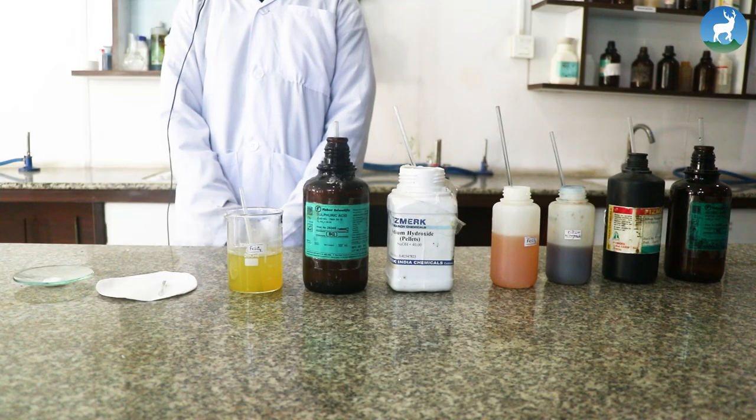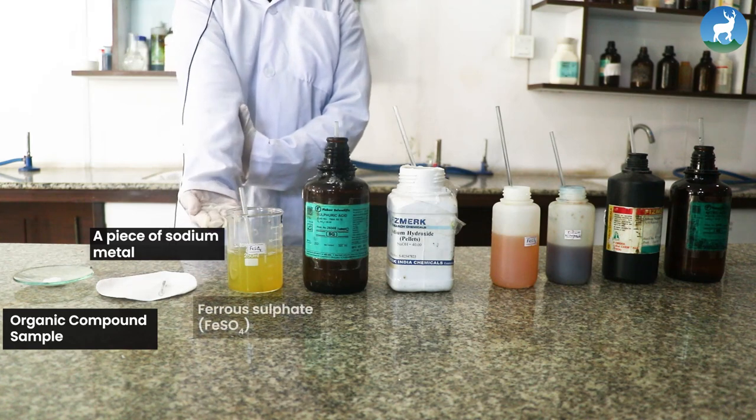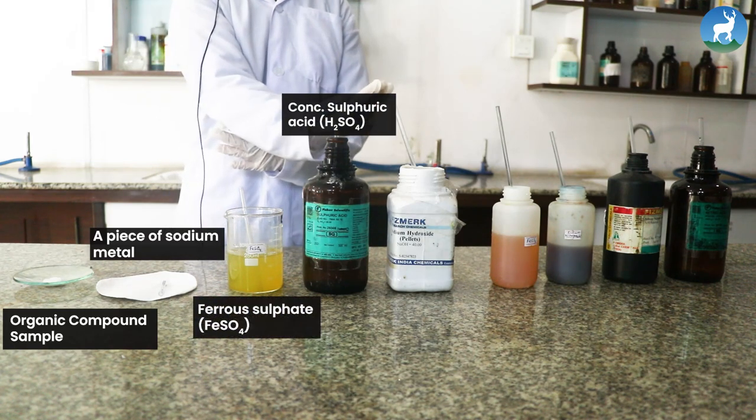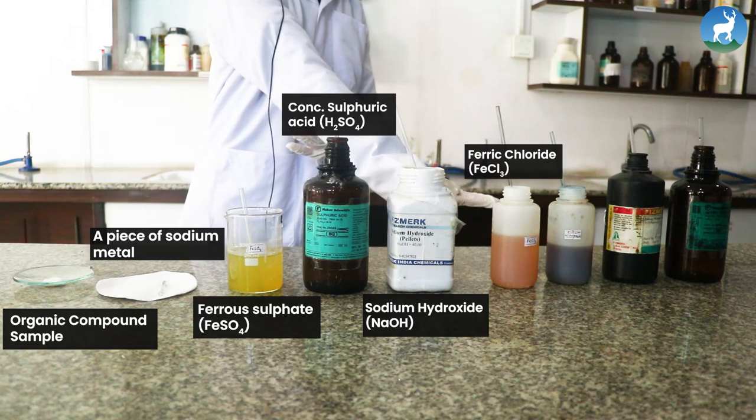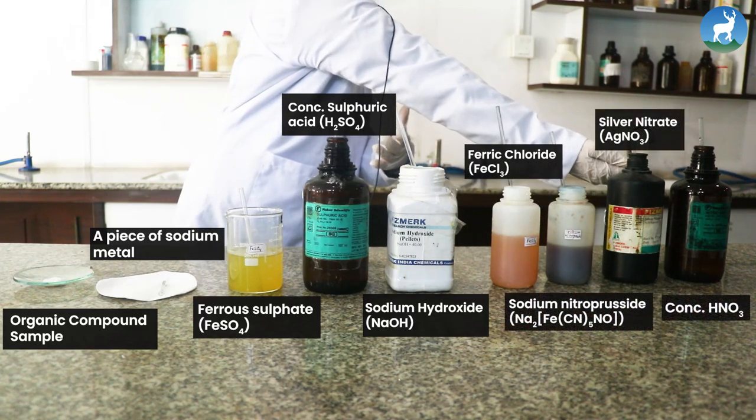The chemicals required are organic compound sample, a piece of sodium metal, ferrous sulfate, sulfuric acid, sodium hydroxide, ferric chloride, sodium nitroprusside, silver nitrate, and concentrated nitric acid.